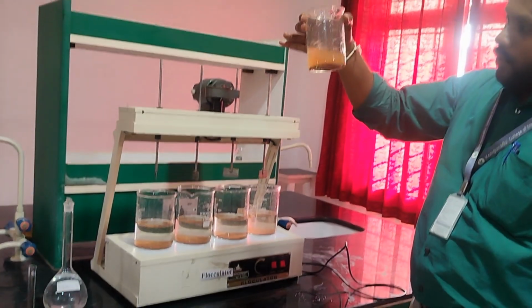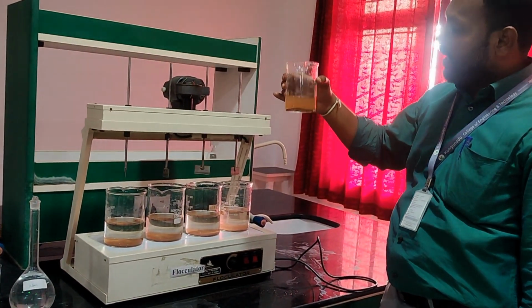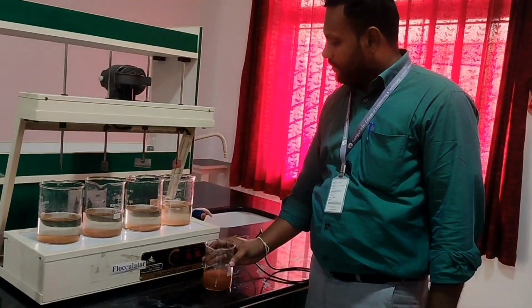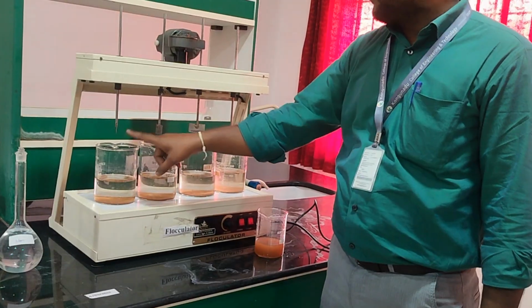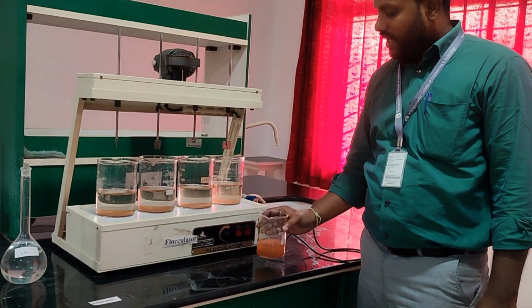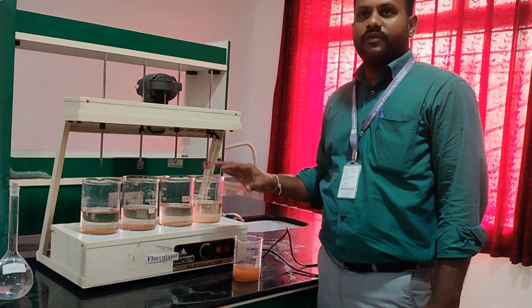So this is the initial water. We already know how to measure the turbidity. The initial water can be taken as sample 1 and used to identify its initial turbidity. Next, we measure the turbidity for each and every water sample. For example, if the initial turbidity is nearly 10, after adding alum it may be reduced to 1, 2, or 3 like that. So you can identify the efficiency based on that.